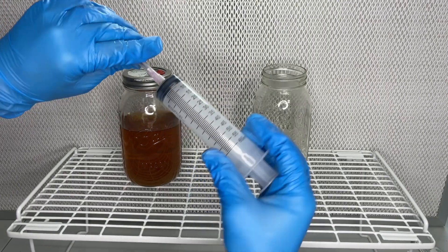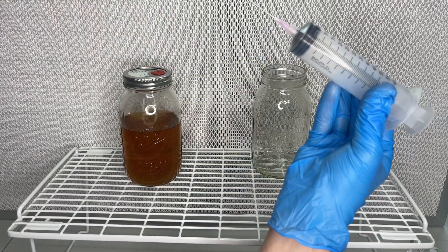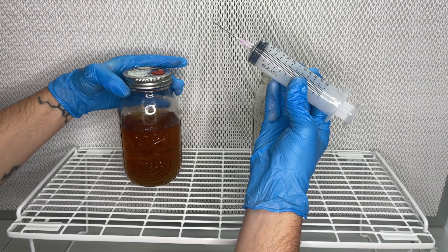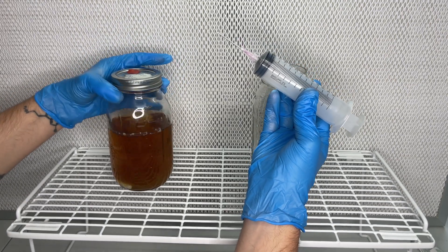I attach a sterile needle to the syringe and insert it into the injection port, and then I tilt the jar making sure not to disturb the mycelium.